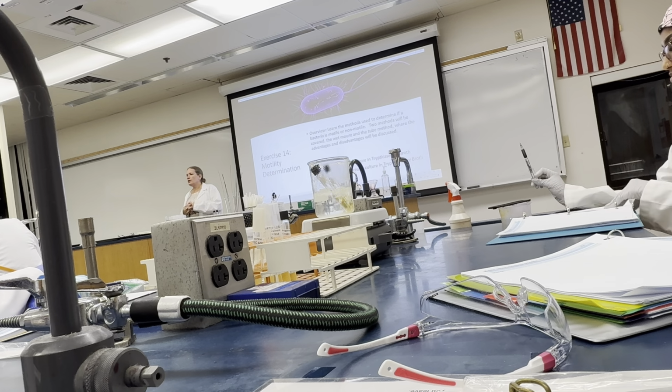If you have 4 people at the table, you'll have 4 motility test media. If you have 3 people at the table, you'll have 3 motility test media. No matter which table, you should have at least 1 Proteus mirabilis and 1 Staphylococcus aureus. You might have more than that. Okay?